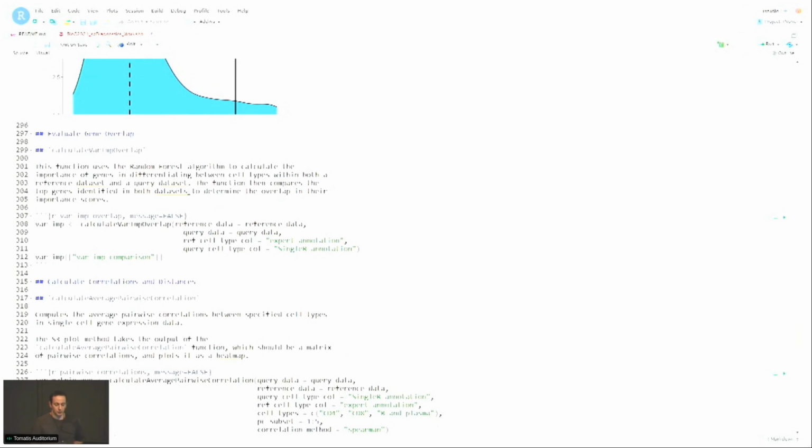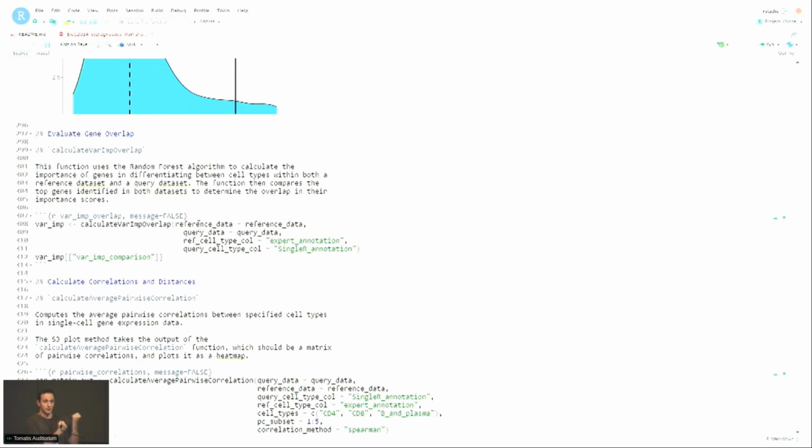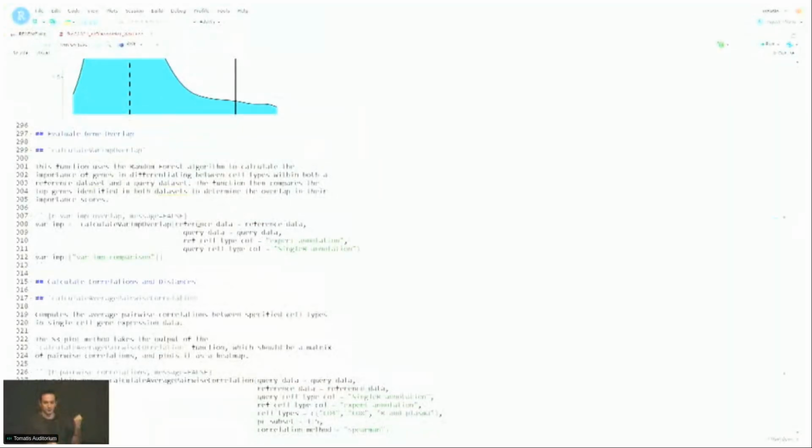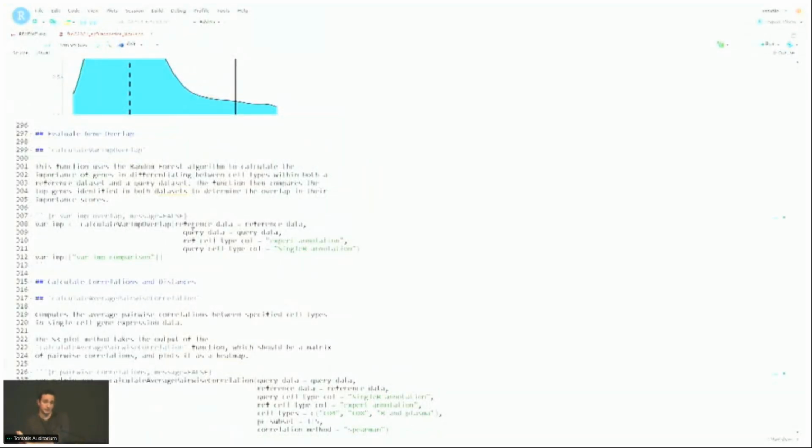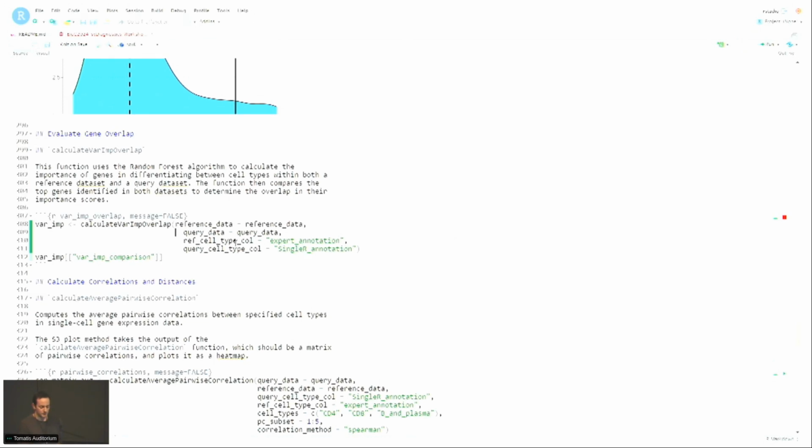There's also functions to compute the overlap between the important genes to distinguish two cell types. So what this function here does is for each binary problem, so for example, CD4 versus CD8 or CD4 versus B and plasma, we compute the most important genes based on the reference to distinguish those two cell types, right? It uses the variable importance measure of random forest to do it. And then you repeat the same process for the query data sets. And then you can compute the overlap between those gene sets. So if I run this here, the function uses a very fast implementation of random forest. So even if you have a lot of cells, it should go pretty quickly.